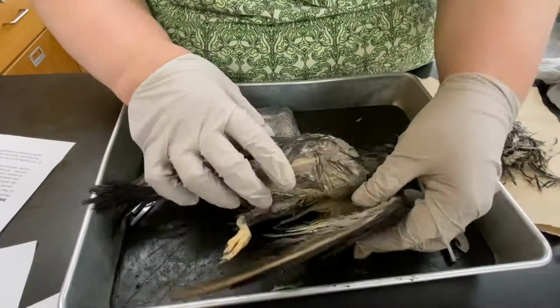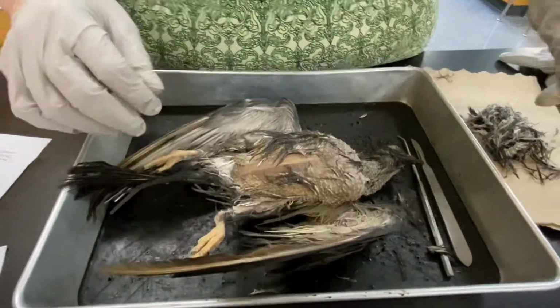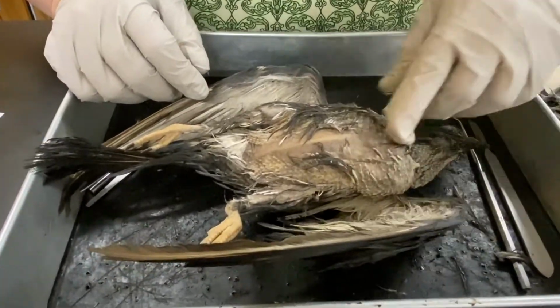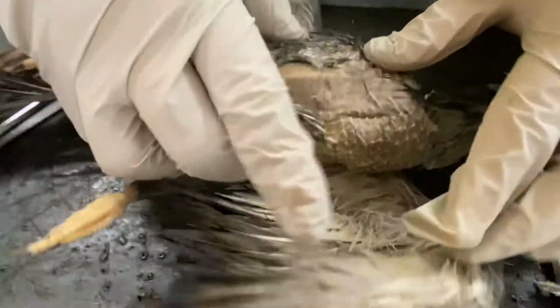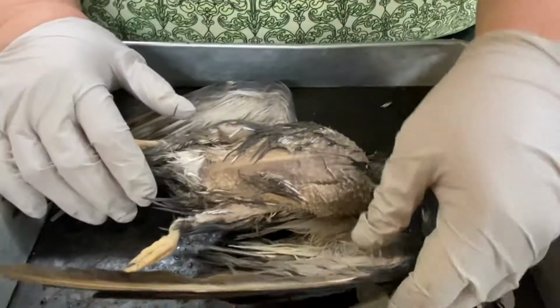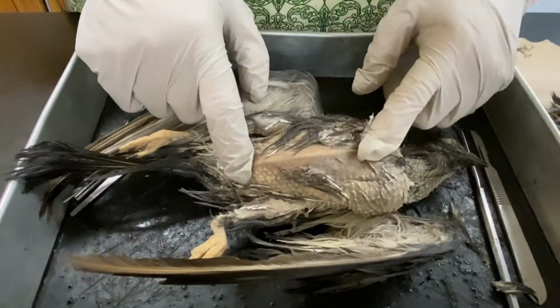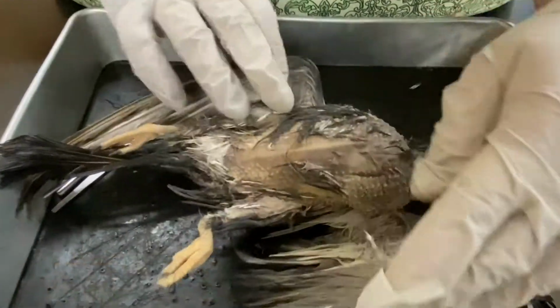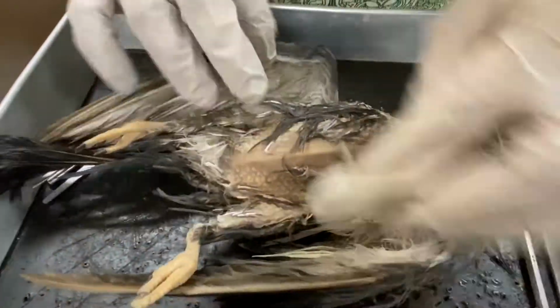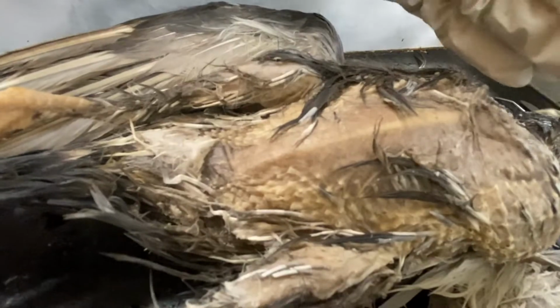Okay, alrighty. So we've removed some of the feathers here, and when we remove the feathers, you can see a couple of things. First off, you can see the insertion points of the feathers, the prickling. You're probably familiar with that anytime you've eaten chicken or turkey or something like that. And then you can also see this ridge here. It actually goes further up, but this one, again, he or she was kind of squished during preservation. You notice it's got a little point down here, so that's the end of the sternum. This ridge is the sternum, and the projection goes out here.